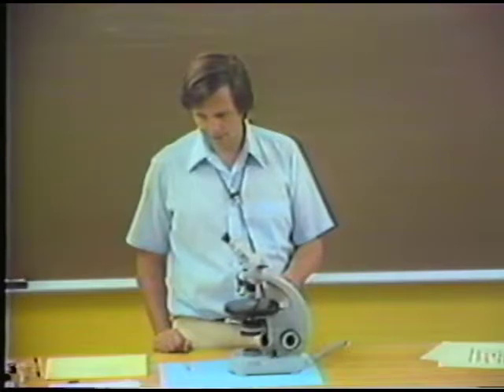And different minerals, particularly those that have iron or other elements within them, have a tendency to absorb some of the visible wavelengths and impart a strong color in transmitted light. So we use this color to aid in identification.